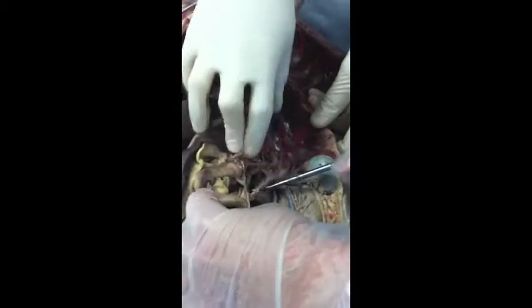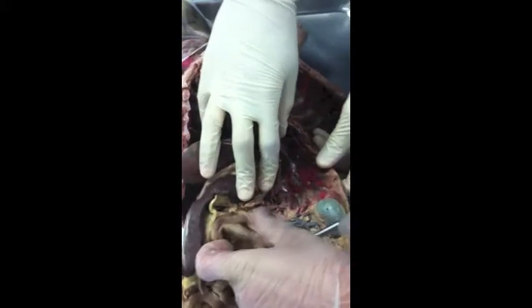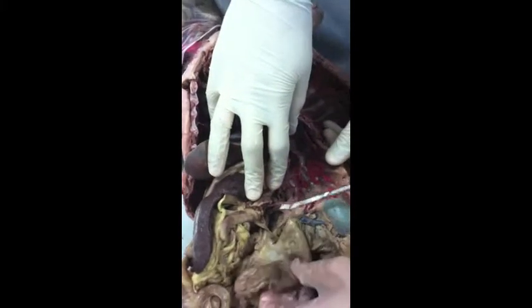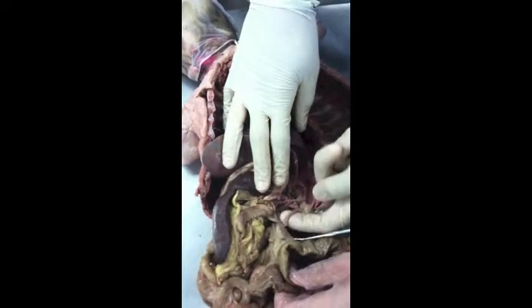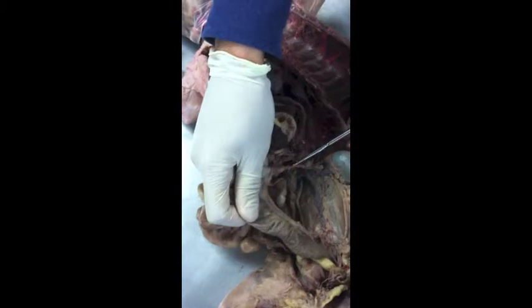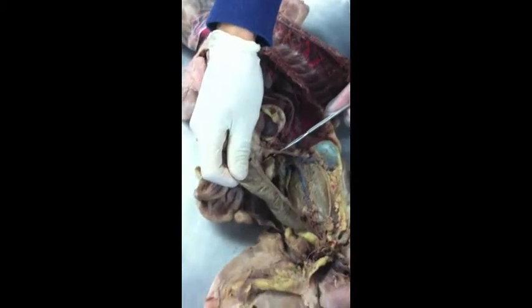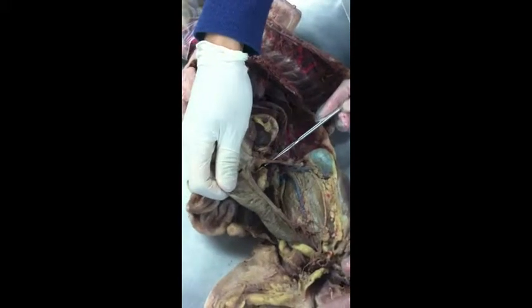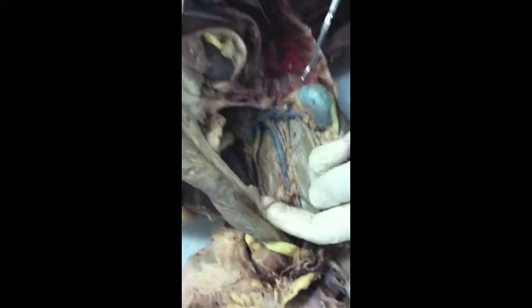What's the one next to it? It's going into the stomach, right? Gastric? No, we're going next to the celiac artery. So look, these two are both reaching up. Is that the splenic? No, celiac. Gastric? No, not the gastric. Keep going. Just keep going down the list. You'll get it. Splenic. It's superior. Oh, superior mesenteric? Yes, and then here's inferior mesenteric.